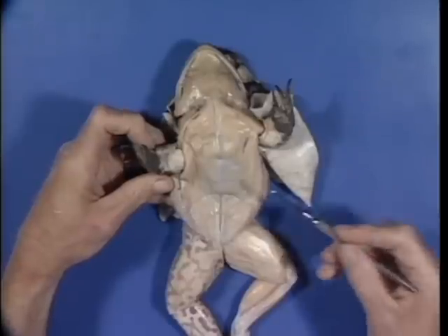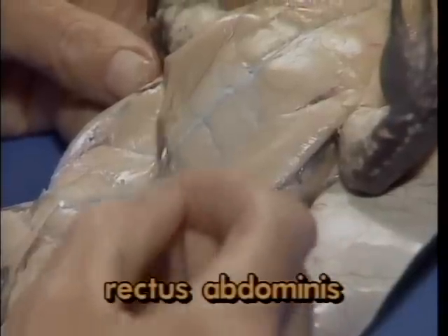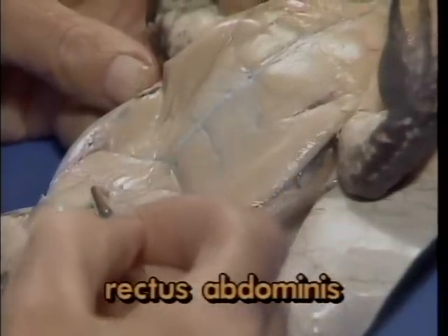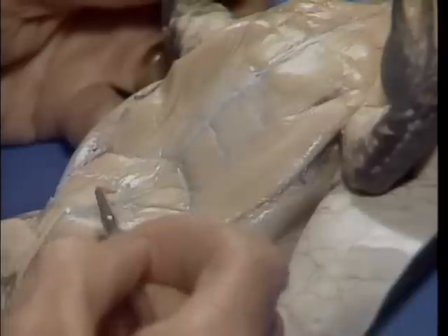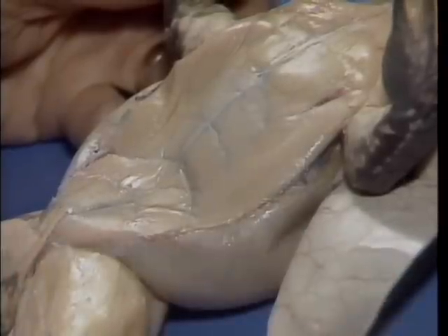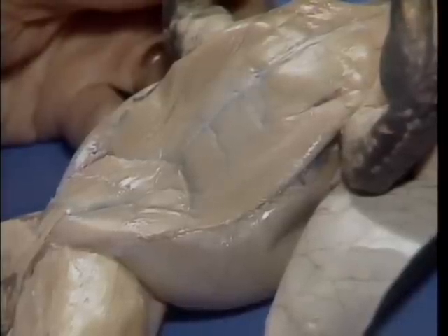Medial to the external oblique is another muscle of the lower trunk called the rectus abdominis. It is a thick supportive muscle system lying in the midline of the ventral surface of the chest and abdomen. It completes our coverage of the major ventral muscles of the head and trunk. The hind limb is extremely well developed and contains a number of muscles used in swimming and hopping.